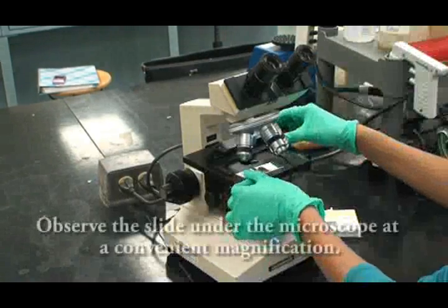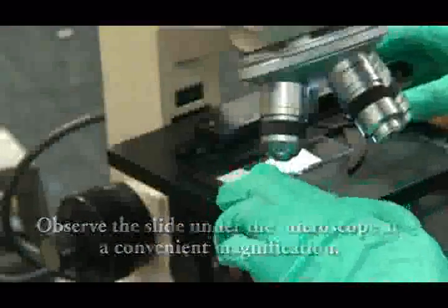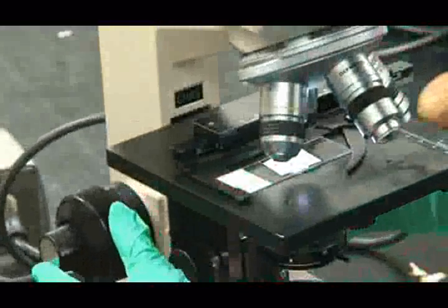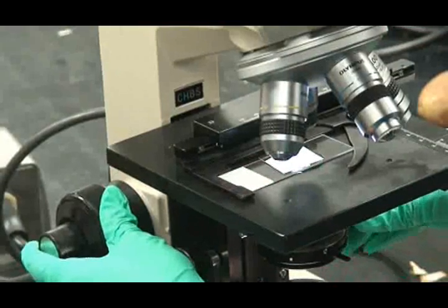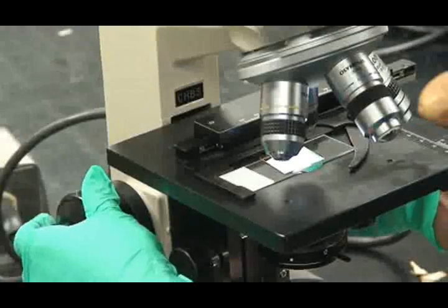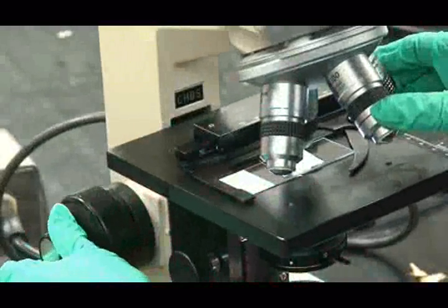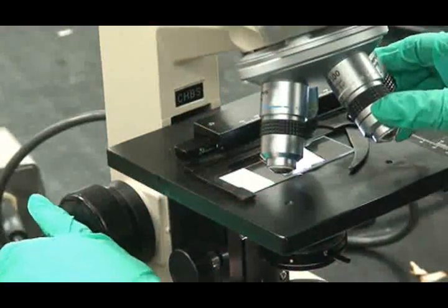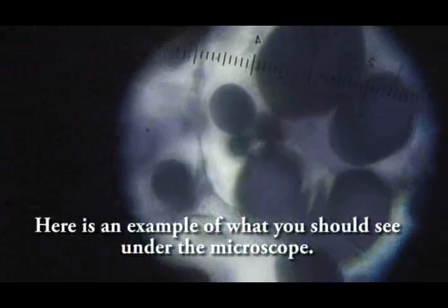Observe the slide under the microscope at a convenient magnification. Here is an example of what you should see under the microscope.